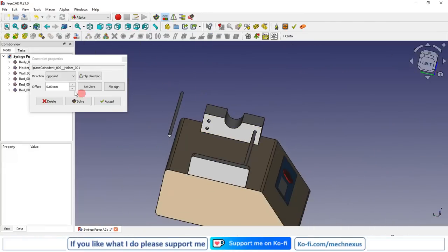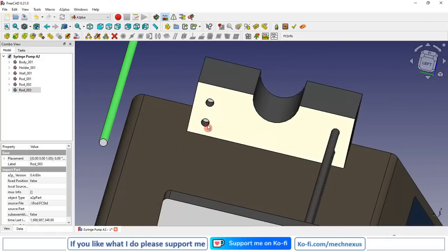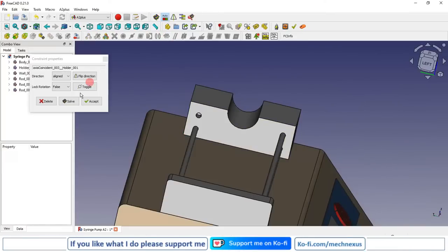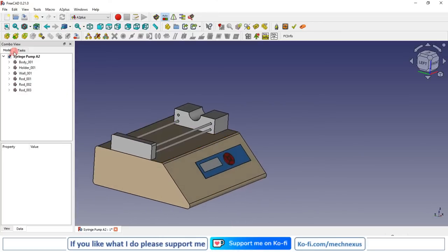Coincidence constraint, accept, and select surface, select surface and give axial constraint. Now one more rod is remaining, we will assemble it.